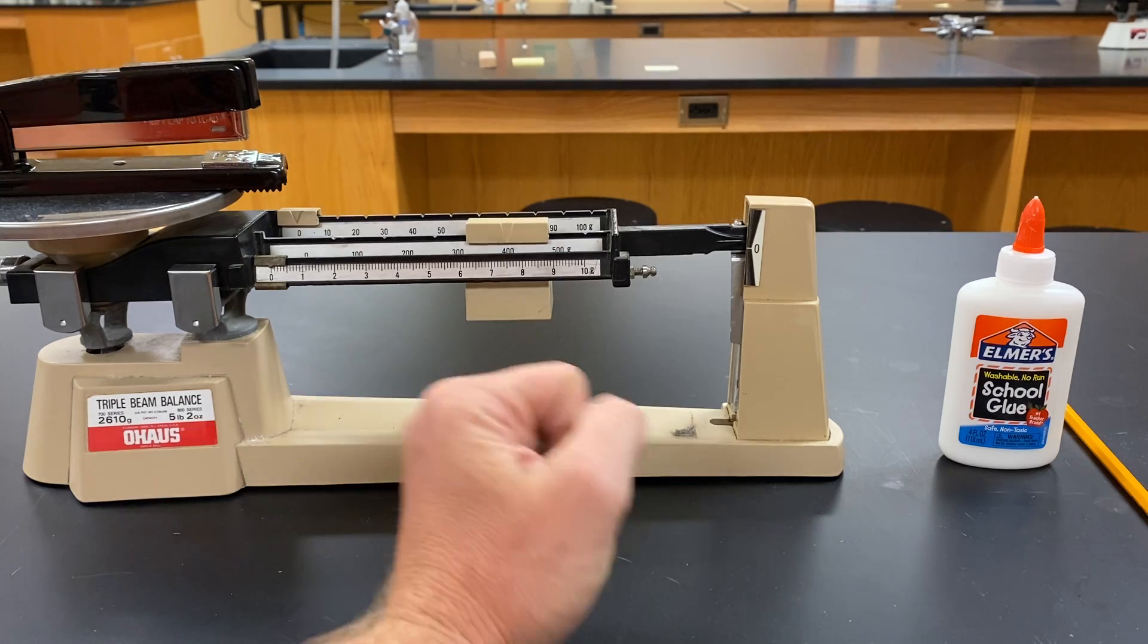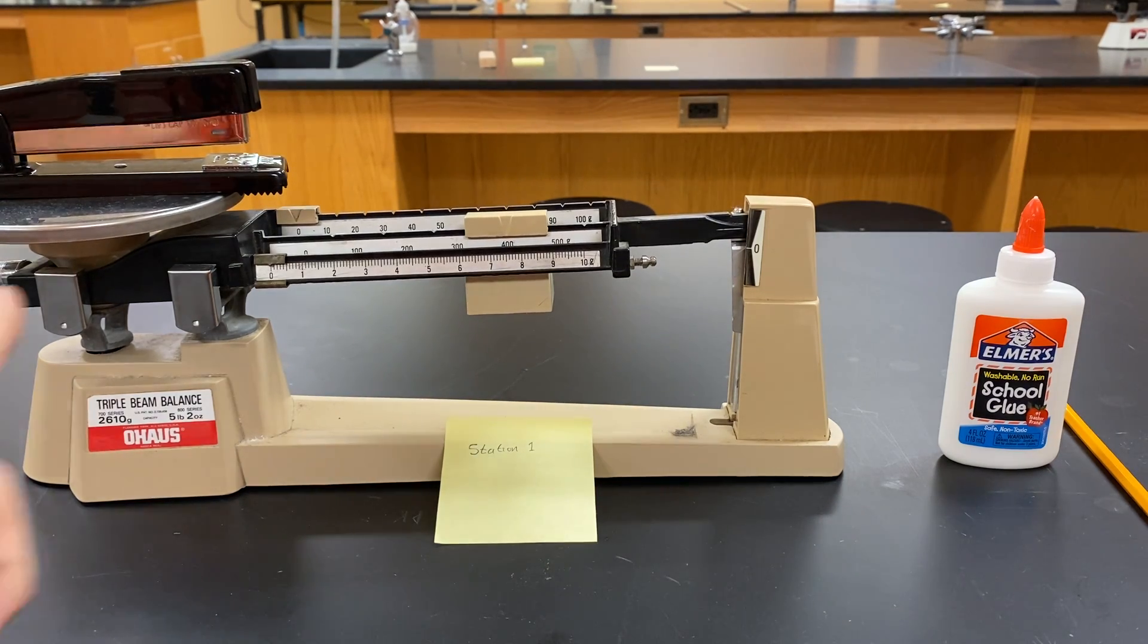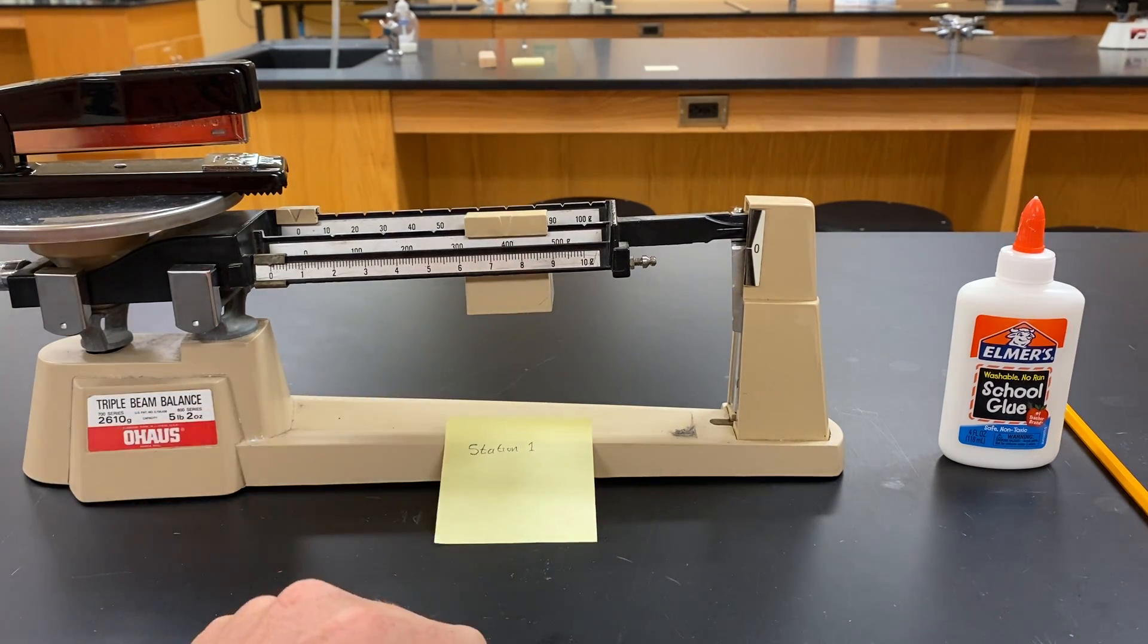We're going to back it up. At 400, this stapler still weighs more than 400 grams as shown.